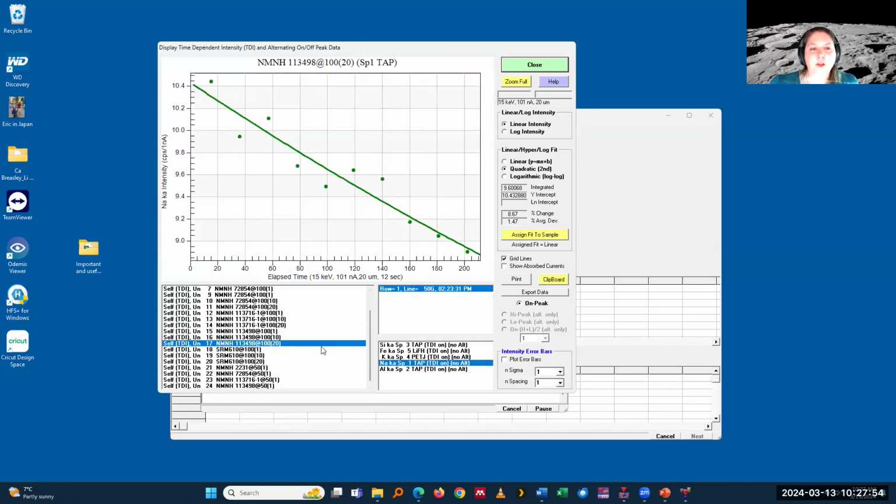And in my experience, if it doesn't show anything in the sodium or whatever is like a major element volatile, none of the other ones do. But it's still useful to just quickly go through and see which one is there. And then one of the advantages of the software is like you don't have to apply a correction.